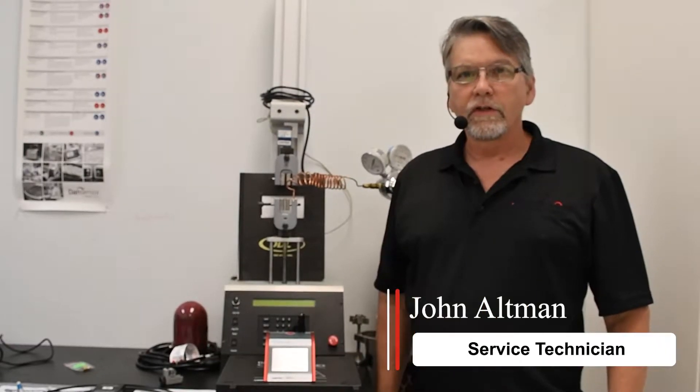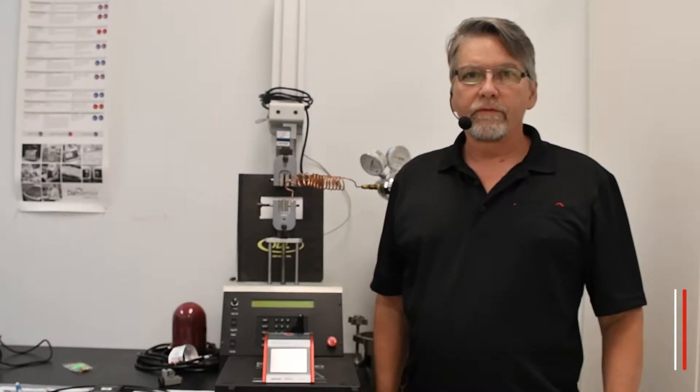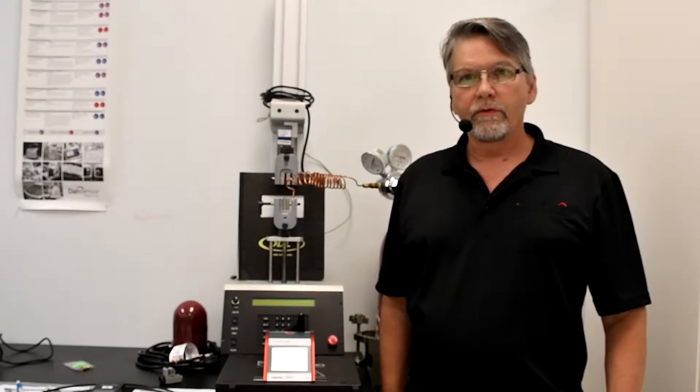Hello, my name is John Altman, Service Technician at MoCon. Today we'll cover the field verification process for your Checkpoint 3.